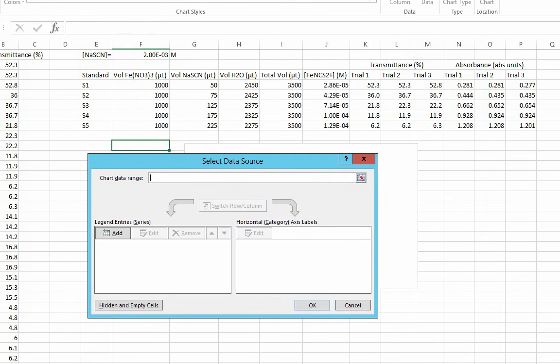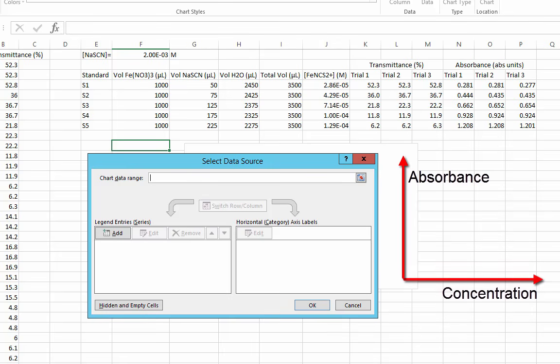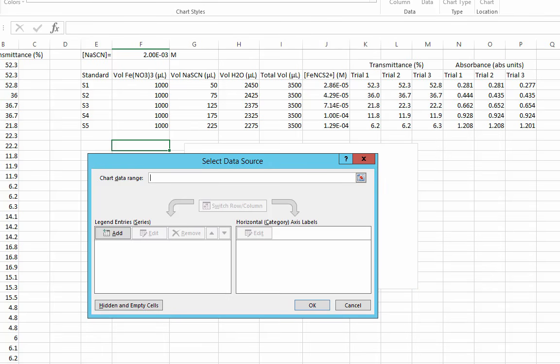Our calibration plot should be absorbance versus concentration. Remember that we say the dependent versus the independent variable, or y versus x. An important note here. You may be tempted to just add 3 series for your 3 trials. We want all points to be taken into consideration in the single linear regression. There are cases when you can have multiple series, but this is not one of them.